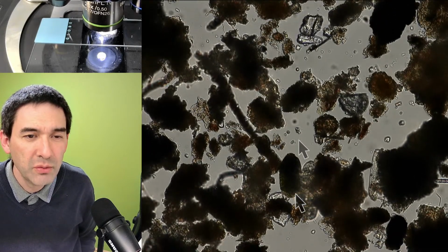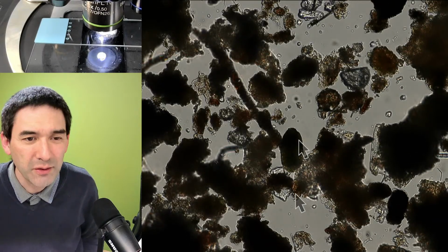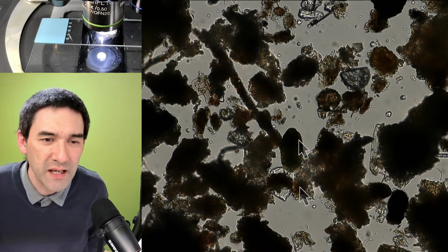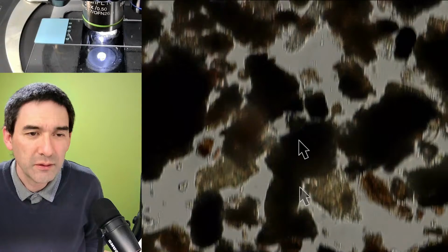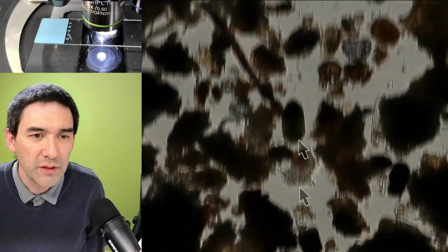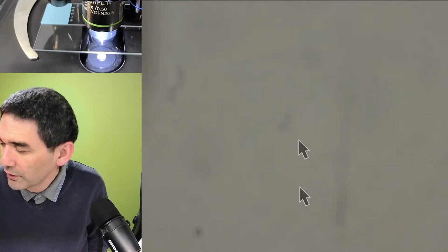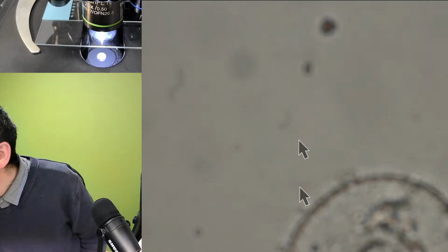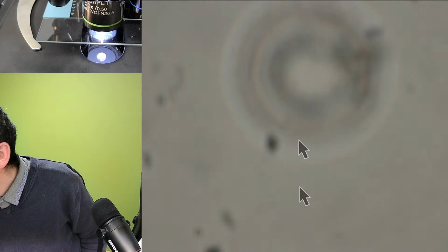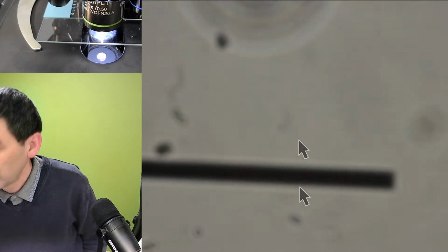Maybe the two arrows are a little too far apart. It doesn't matter, right? From arrow tip to arrow tip, that's the size of a water bear approximately. Okay, where is it? No, that's not it. I bumped the stage. Here it is again. Now let's quickly move over, and I have to find where the line is.